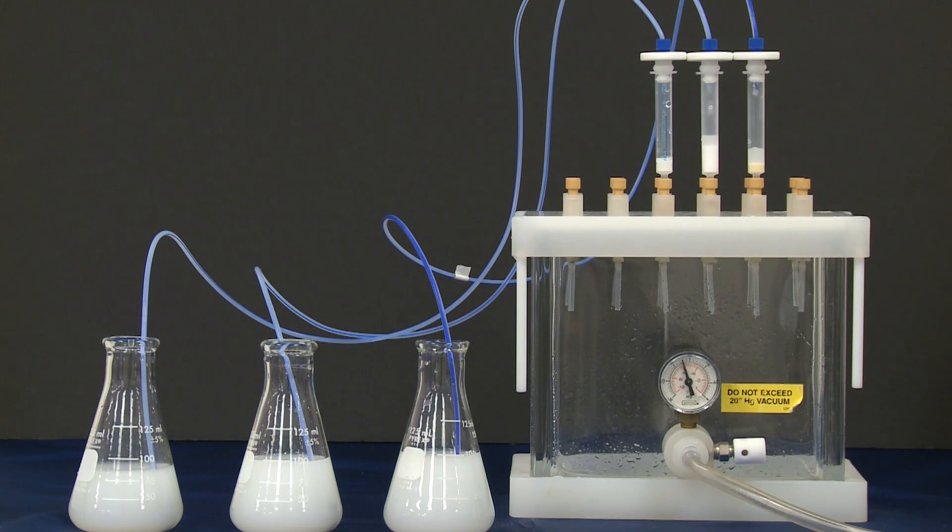Using a large-volume water sampler, we are going to run this sample through all three cartridges without any pre-filtering.